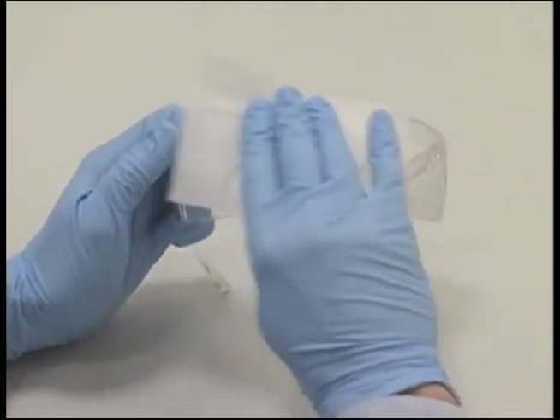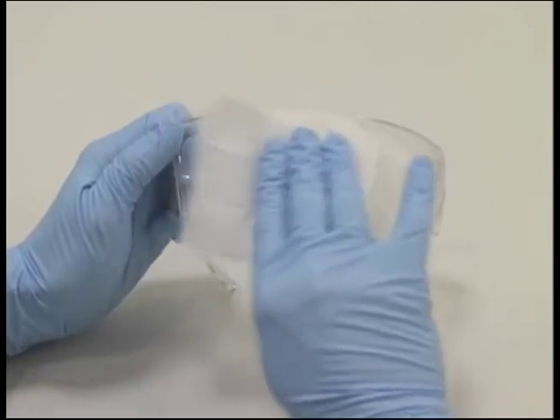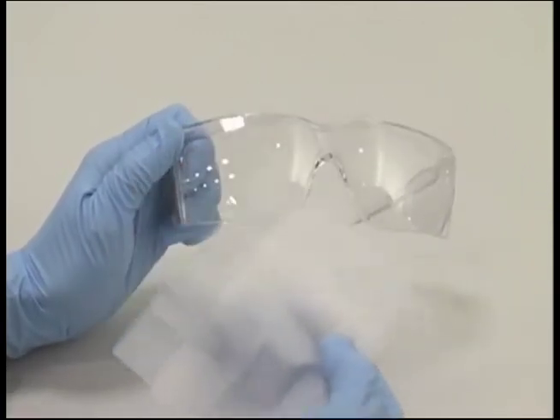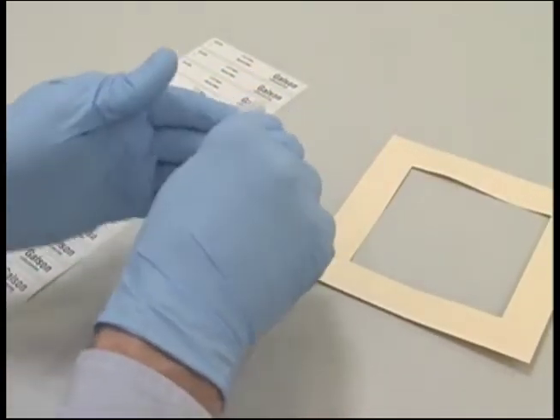Wipes may also be used on irregular surfaces such as shoes or glasses frames. In many cases, such as knobs and levers, it may not be possible to wipe 100 square centimeters.